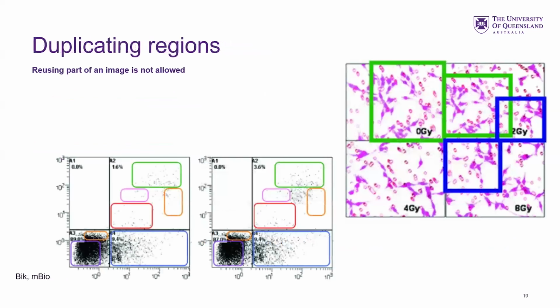You're not allowed to duplicate regions of things. I know this might be obvious, but they get caught quite often. Elisabeth Bik is a forensic image analyst and often tweets stuff, and you can see in these two plots the same stuff is used. There's just a slightly different density in the middle here. Likewise, there's a resized and reused region. Yeah, totally.